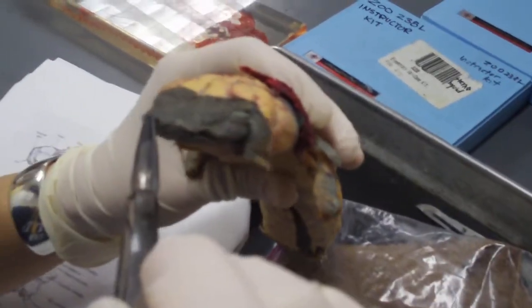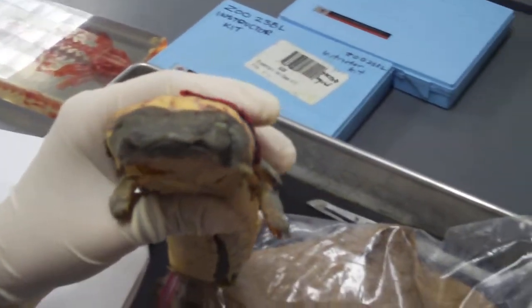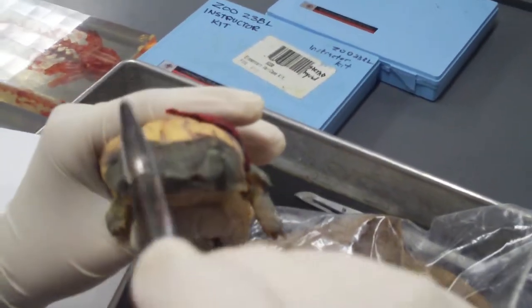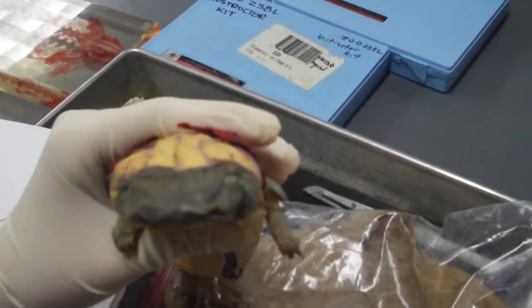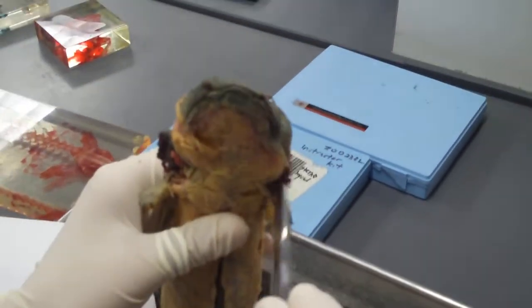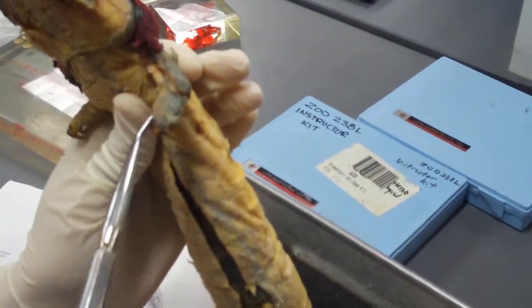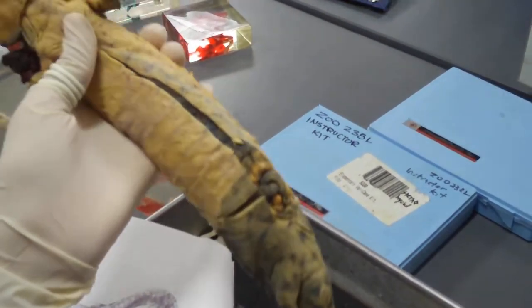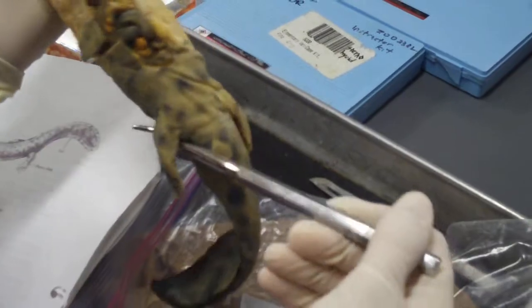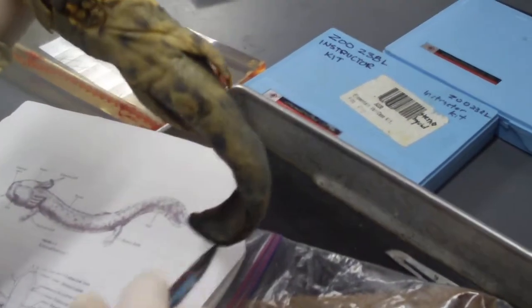External nares there and there, and then you have eyes there and there, the head, external gills, the trunk, pectoral limb, pelvic limb, and the tail.